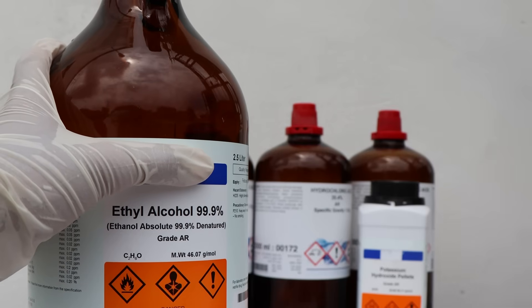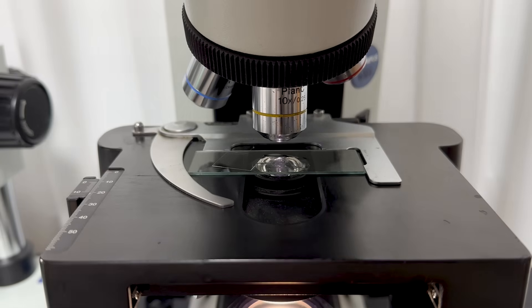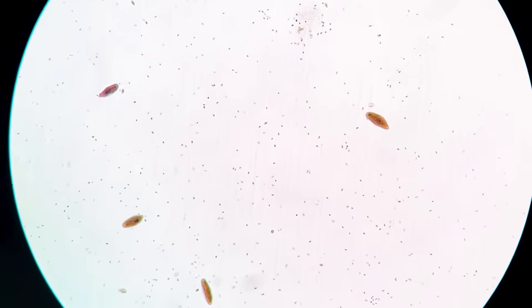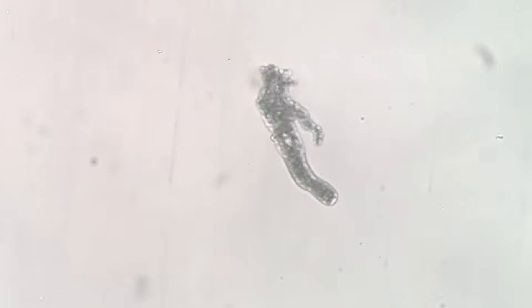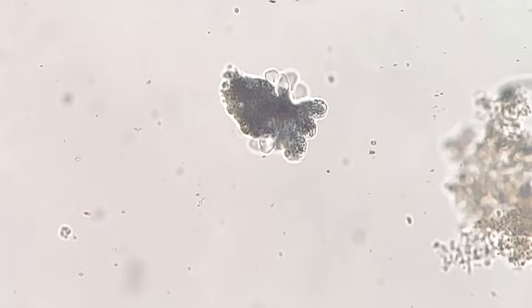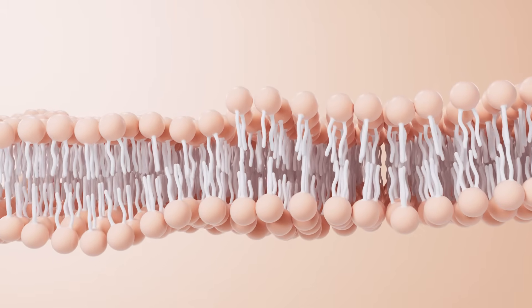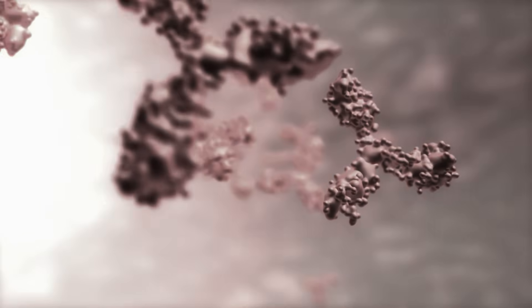Finally, we prepared some rubbing alcohol and tried dropping it on the protists. First, we dropped a bit of alcohol on the paramecium — it died almost instantly. Then we tried the same with the actively moving amoeba, and it too died in no time. The reason protists are so weak to alcohol is because they're single-celled organisms, which means alcohol can easily destroy their cell membranes or denature their proteins.